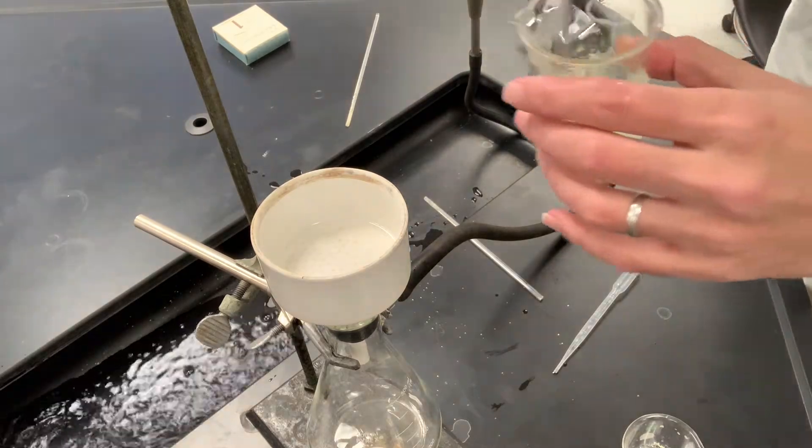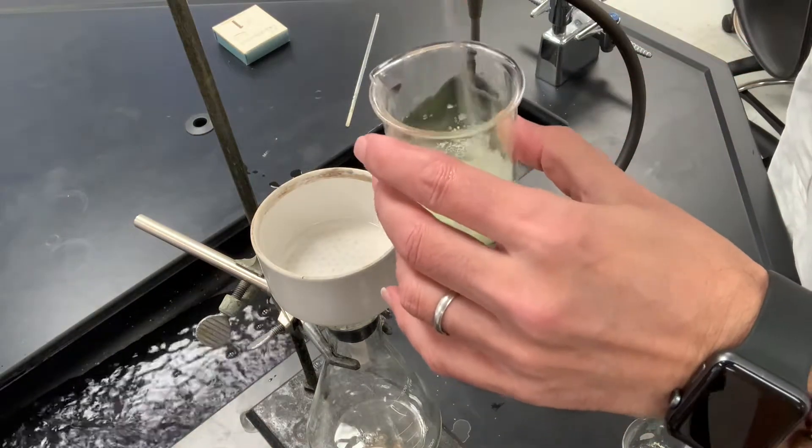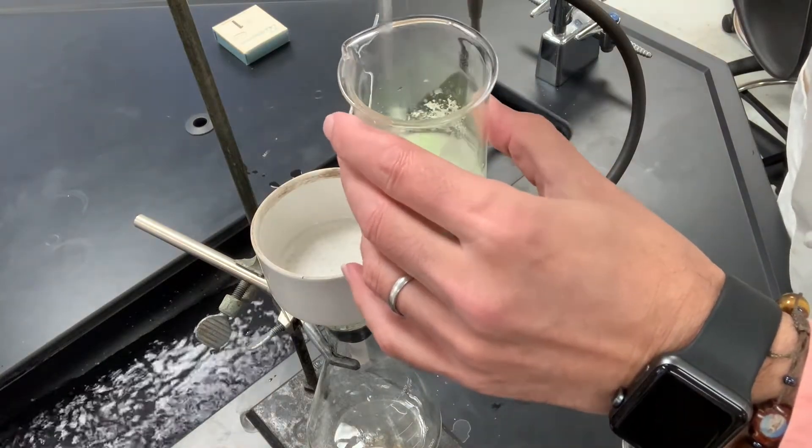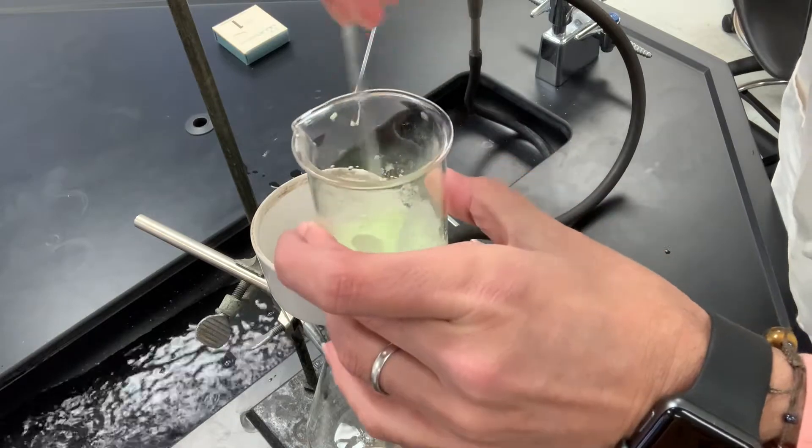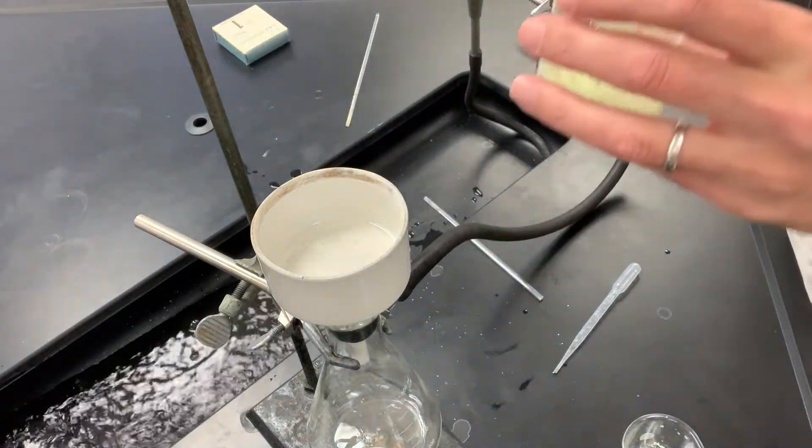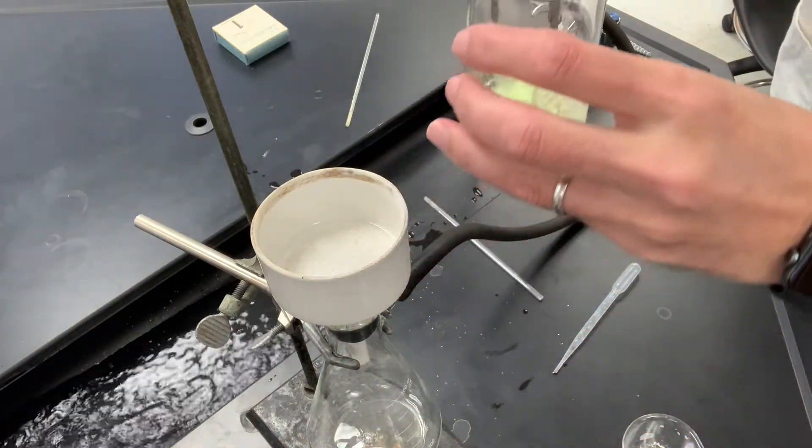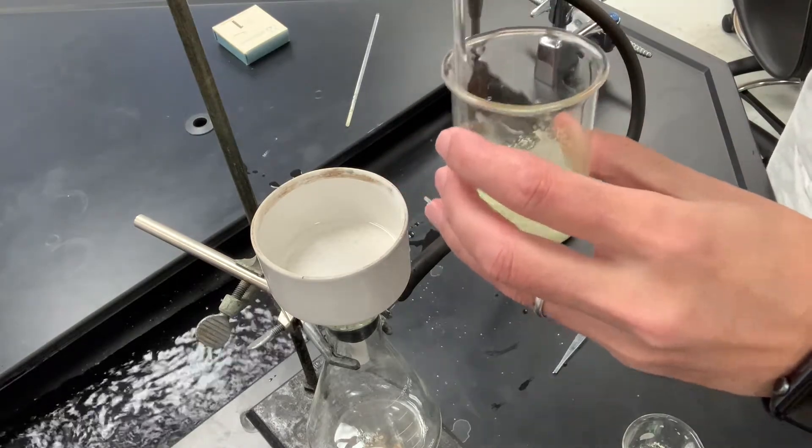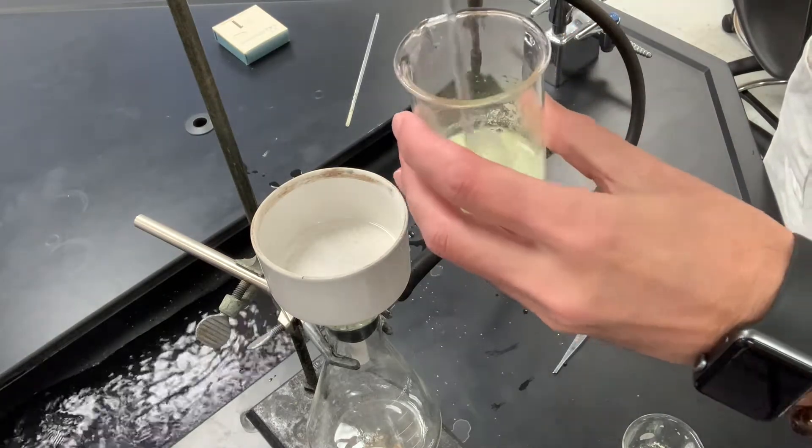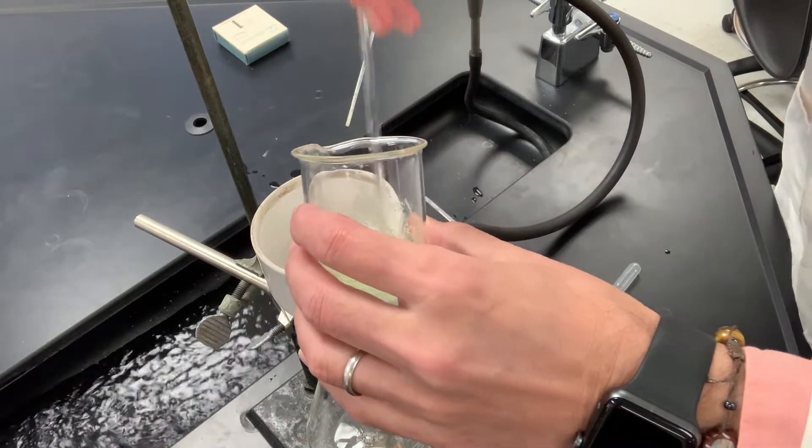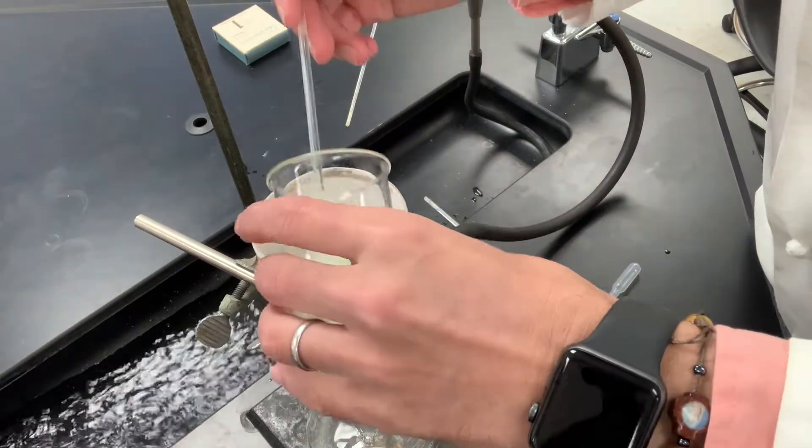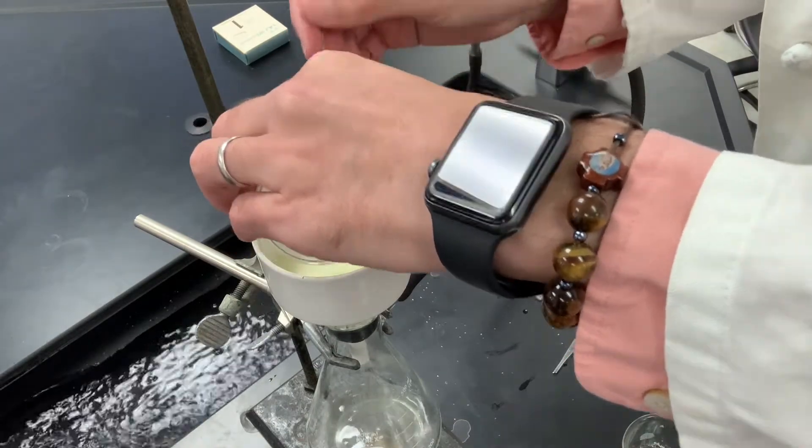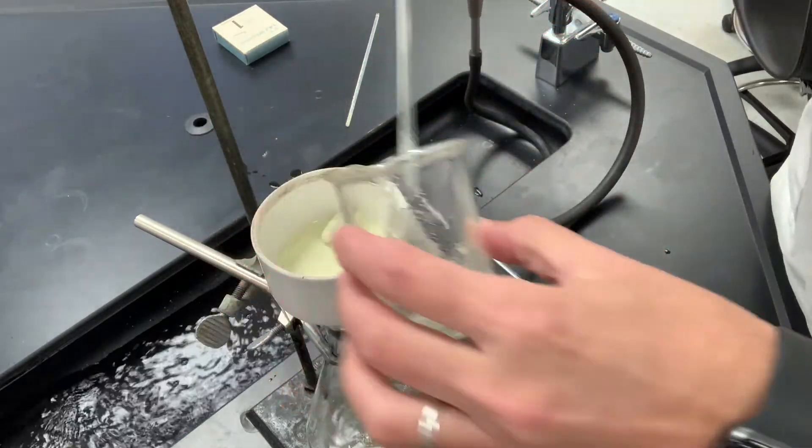This has been kept cold in the refrigerator, so now we'll go ahead and filter it. It looks very similar.